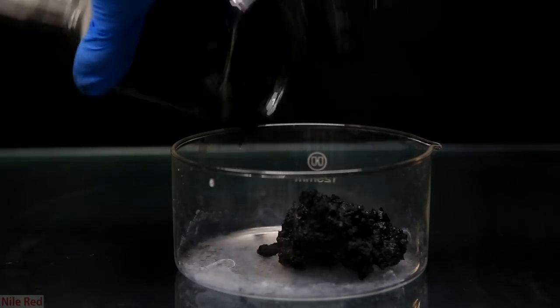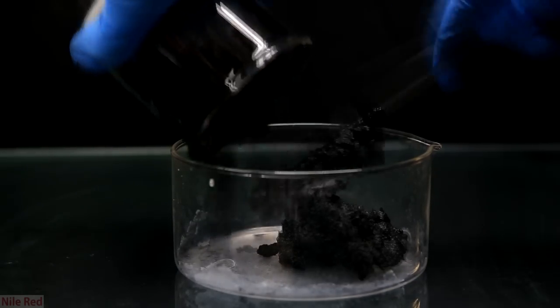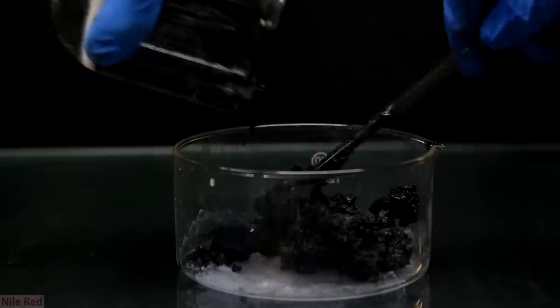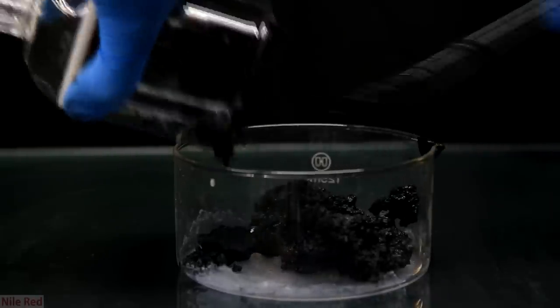After the water's gone I keep the vacuum pulled on it to get it as dry as possible. Once this is done I transferred it to a crystallizing dish. You can see that it's pretty pasty and definitely not dry and to fix this I'm going to dry it in an oven.